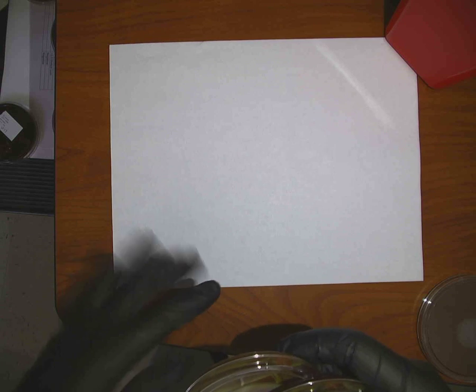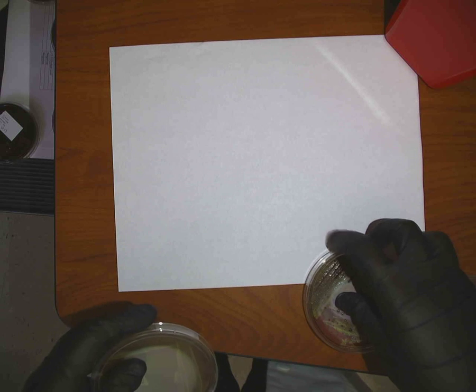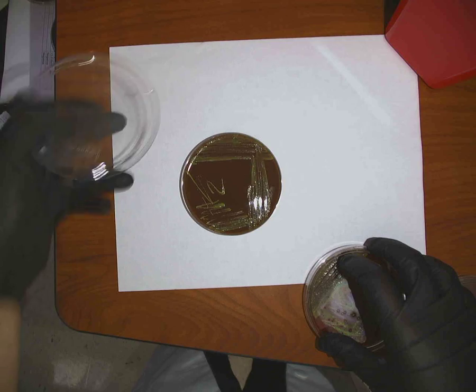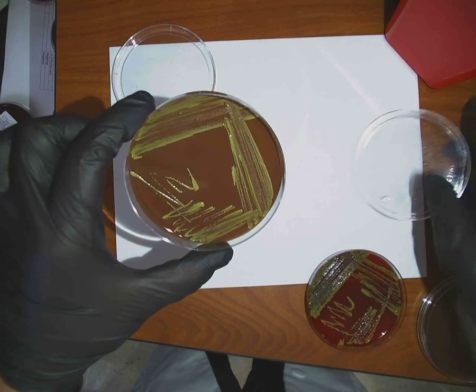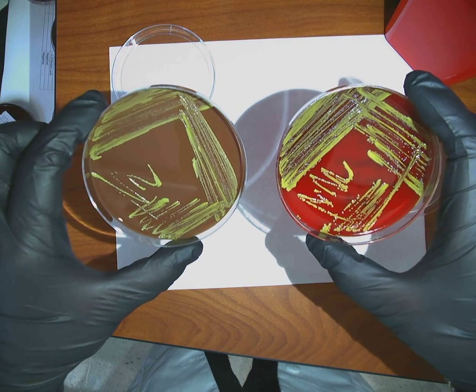This is a urine sample from a patient who has been bedridden for a long time in a nursing home and has had a history of UTIs, all right? And for some reason, my tech plated it on chocolate, and I don't know why, but we don't plate urines on chocolate. All right, before you tell me what it is, tell me what you know it's not.